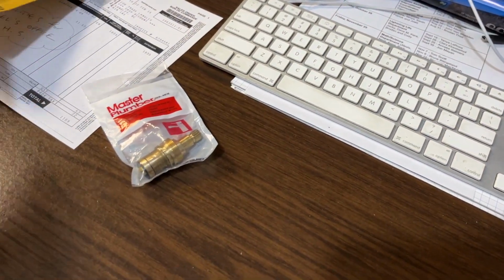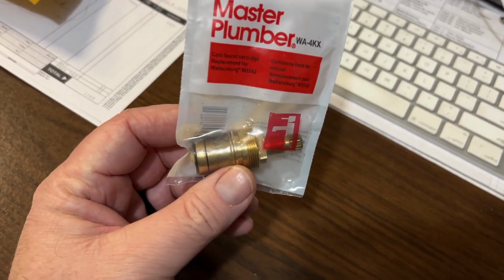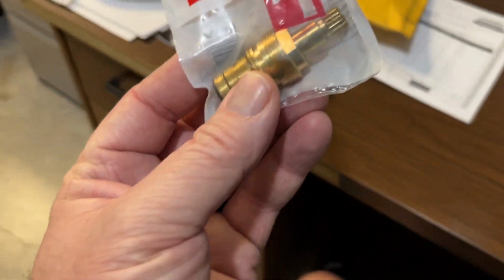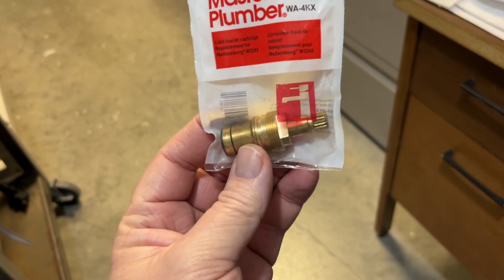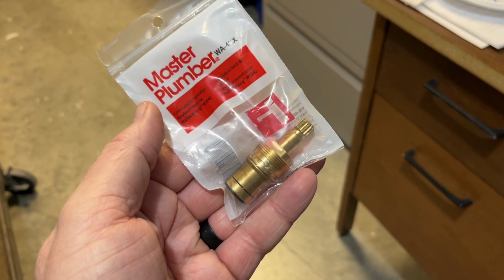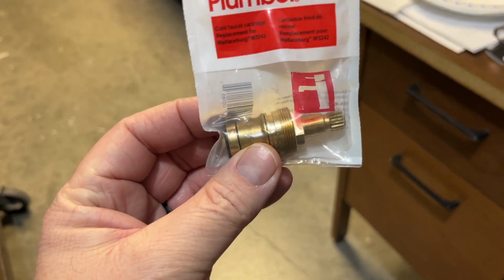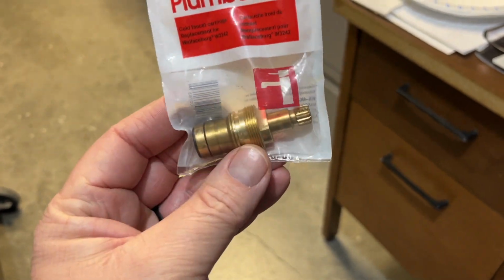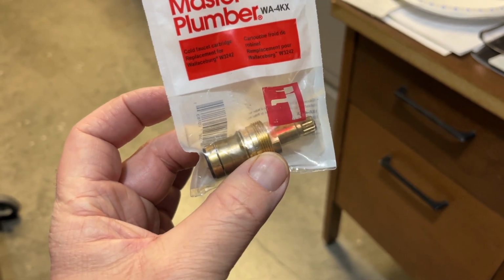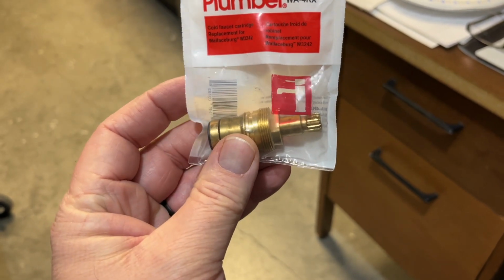This is a replacement cartridge, and while I haven't compared it to the one in the faucet currently that's leaking, this one, at a glance, looks identical. And what's interesting about that is it is not listed as the cartridge for this particular faucet. This faucet is discontinued, and I could not find a cartridge make or model for it. But I just did an image search through the Google machine and found an image of this, and it is for something completely different. However, like I may have mentioned, faucet manufacturers don't necessarily create or manufacture their own cartridges, right? They would go to a cartridge manufacturer and say, hey, have you got something that'll work with this faucet? And I believe I have found a match. Let's go find out.